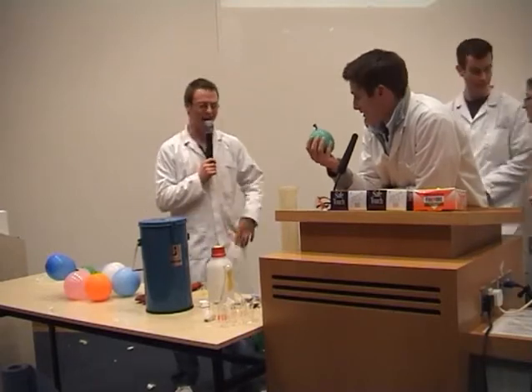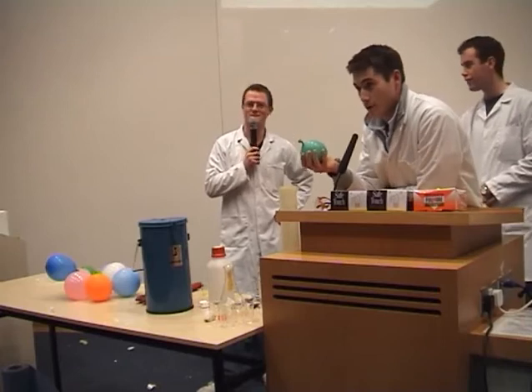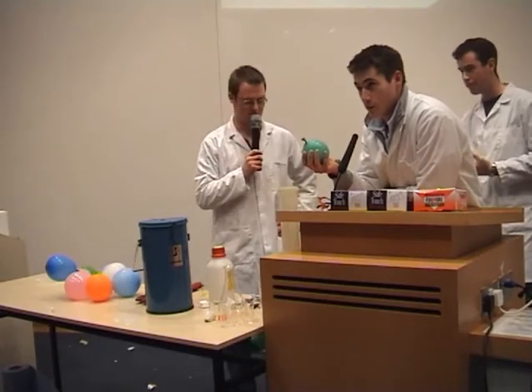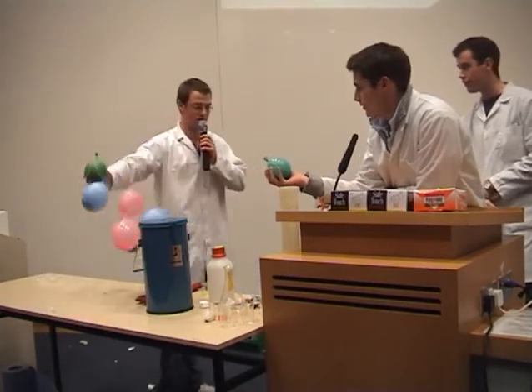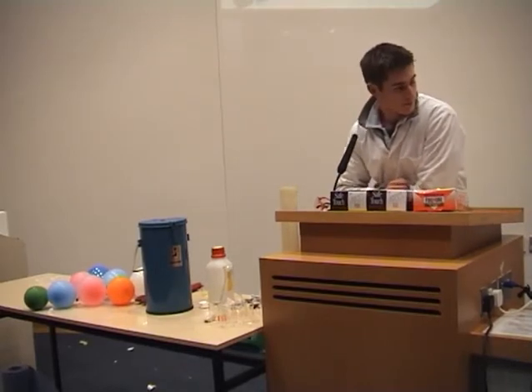See it this way, right? So all we have to do is try to put the water balloon into the liquid nitrogen, right? See what happens there. And then we're going to give him an egg, right? See if it works. Get rid of the balloons.